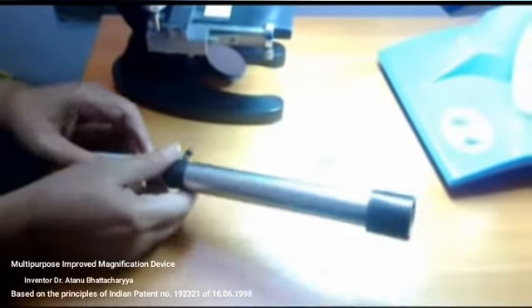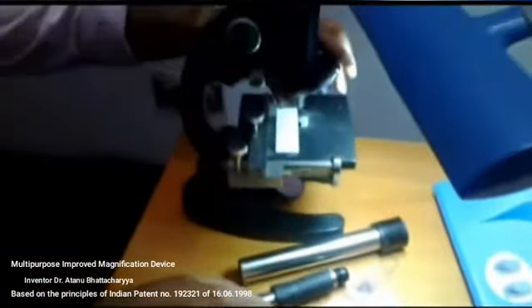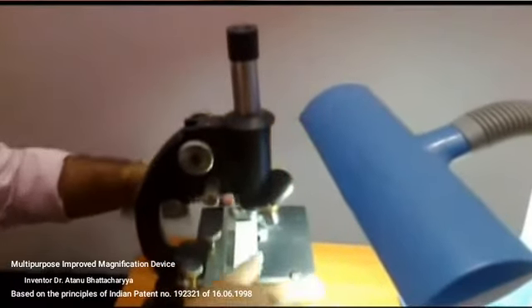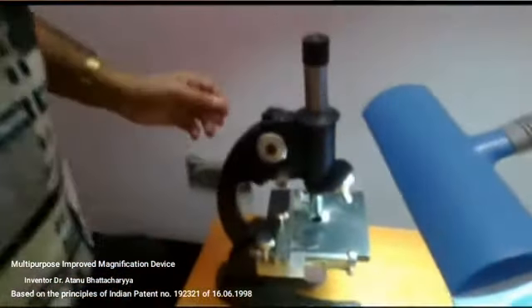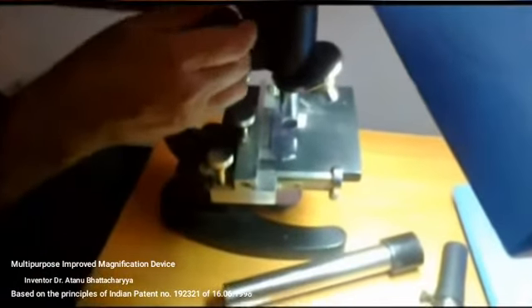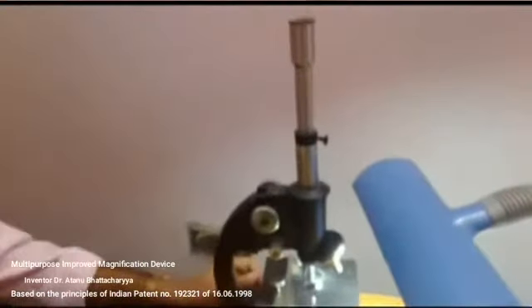Now I am describing the principles about the device. Actually, this is a microscope which has a magnification power of 40 times. Now, when I wish to see the very highly magnified image, then the tube T1 has to be pulled much more, and then after adjusting the slide on the microscope, the image has to be seen, and after removing the eyepiece of the microscope, this device has to be kept on the microscope. So what is the principle?